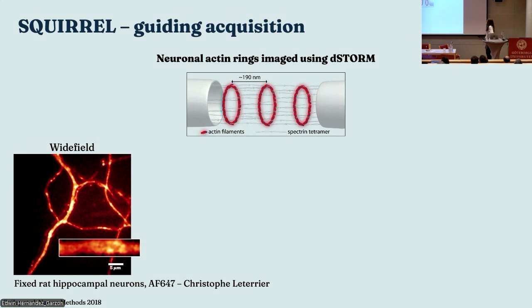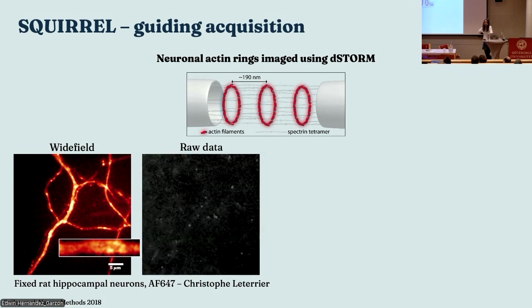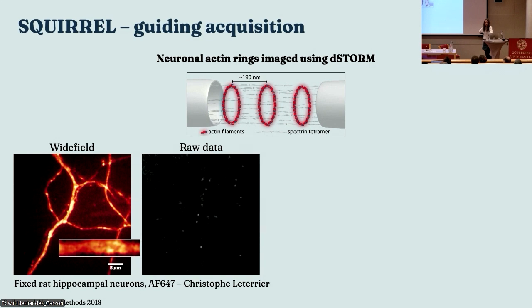Okay, so what is maybe a useful way of doing this kind of error assessment? Again, as bioimage analysts, we often end up on the data side, right? We might get involved in the acquisition, but sometimes you just get a load of data given to you. These are neuronal actin rings imaged with dSTORM, and this is what they look like in wide field, just kind of mush. And here's some raw data. Now a question that a microscopist or a biologist might have is, how many frames do I need to image in order to get a nice super resolution reconstruction?